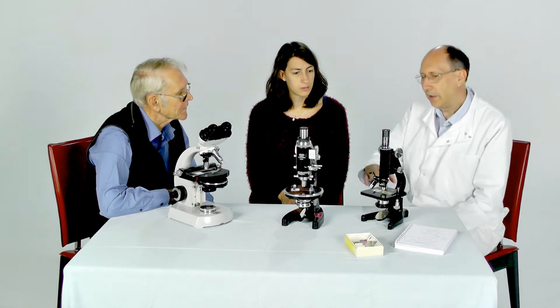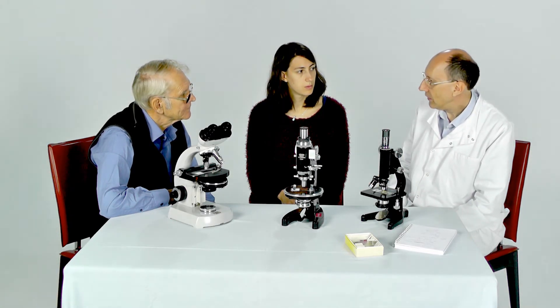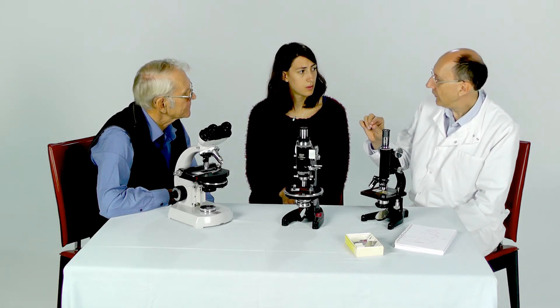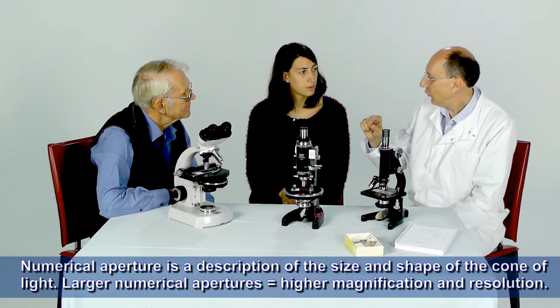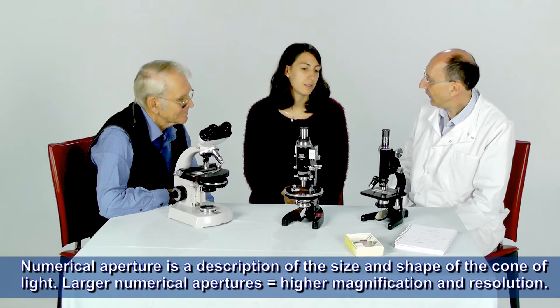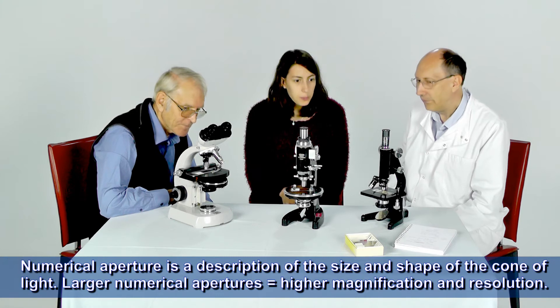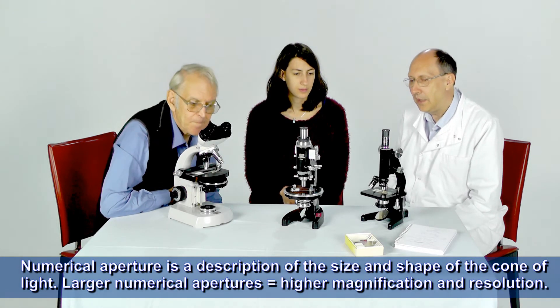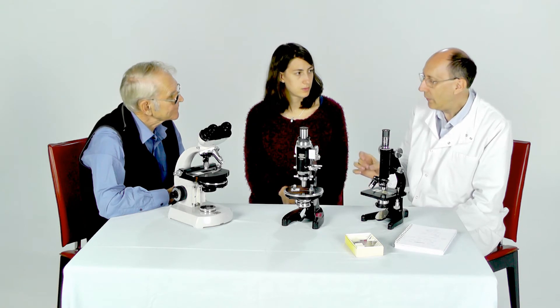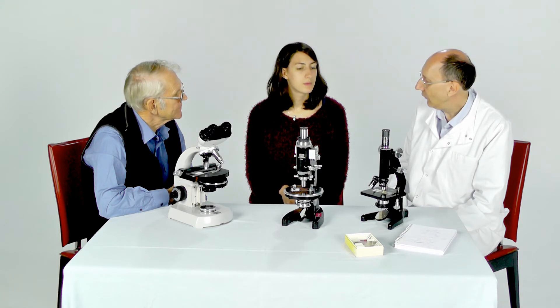Although it's very difficult to see because the condensers are actually built in within the microscope, they can be taken out and you can look at the top of the lens. They will often have a little figure on the side saying N-A — numerical aperture — and giving a figure. We came across numerical aperture when we were looking at the objectives, and the idea is that you need to have a condenser with a numerical aperture that is equal to or greater than the numerical aperture on the objective that you're using.